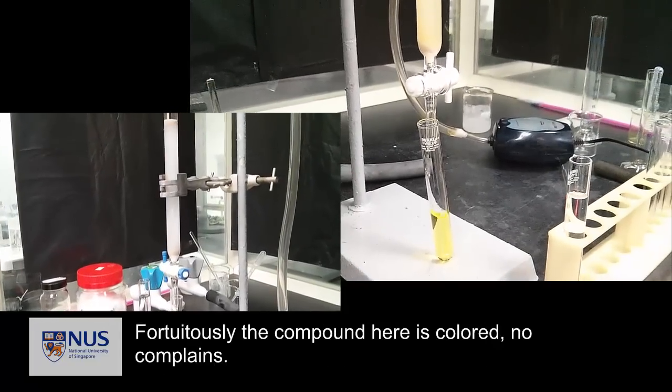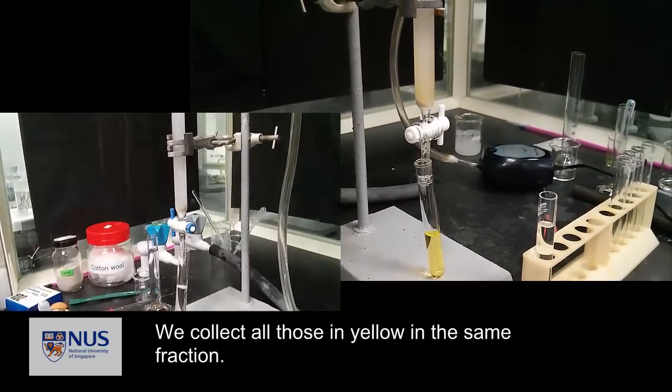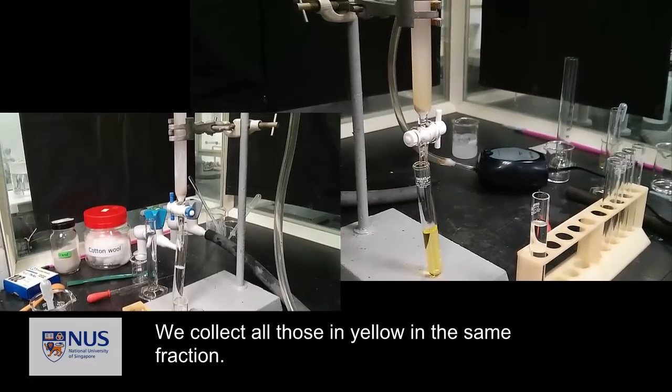Fortuitously, the compound is colored here, so there are no complaints. We collect all those in yellow in the same fraction.